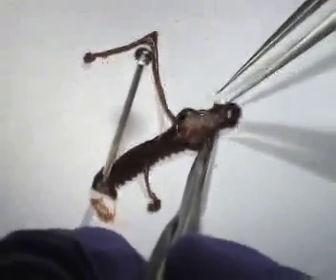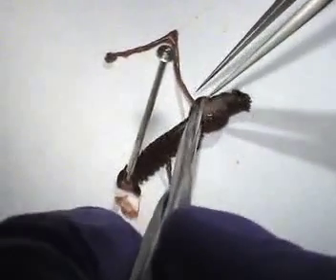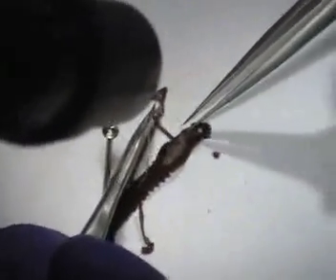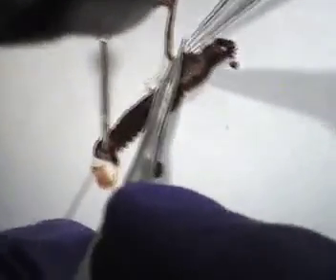Look at that — I'm removing it. It's the big thing down the middle. That's not the uterus — oh sorry, the white thing is the uterus right here. There are two of them. Two gut tubes? No, no — there are two uterine horns. The thing you're holding — it has two. I think this right here is slime, and this was actually a straight line before I pulled it out.